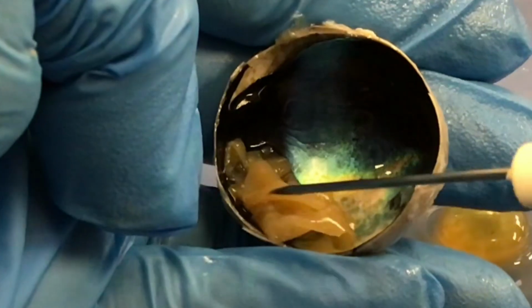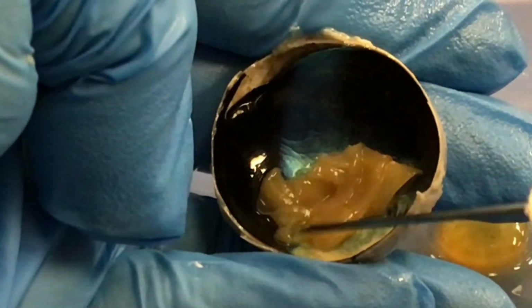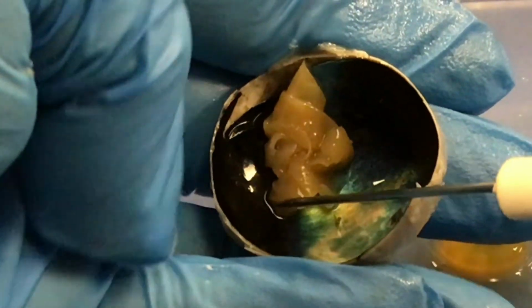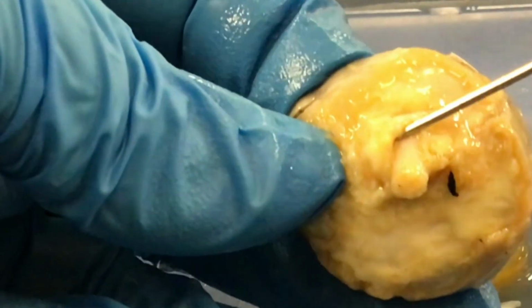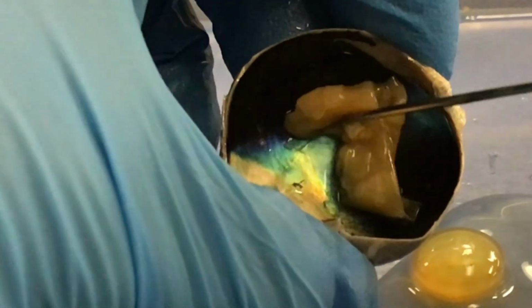Now also at the retina, where it bunches up at the back of the eye, that's where the optic nerve would leave the eye. So you can see sort of in this area, and if I flip this over, that is going to be where the optic nerve is coming out of the eye, optic nerve here. And this area on the retina, where the optic nerve leaves the back of the eye, that's called the optic disc or the blind spot, because there's no photoreceptors in that area. Okay, so that's the posterior part.